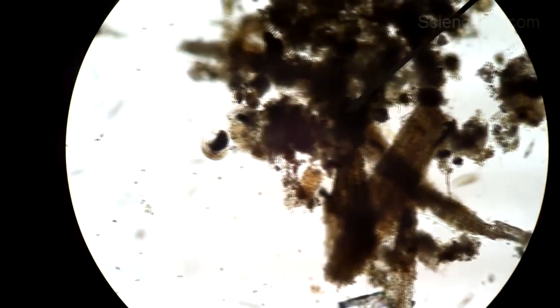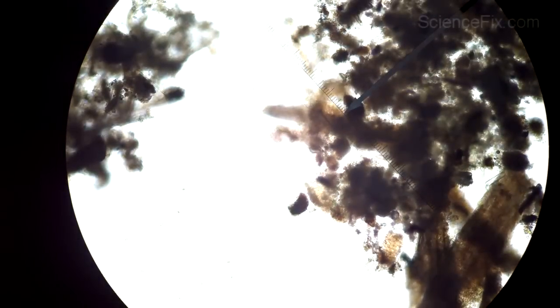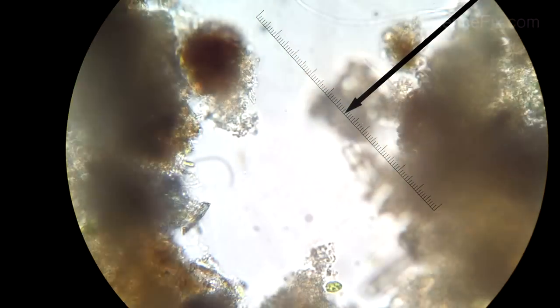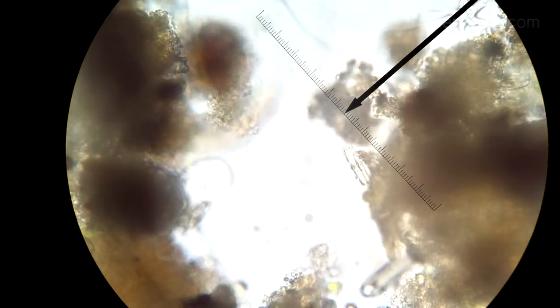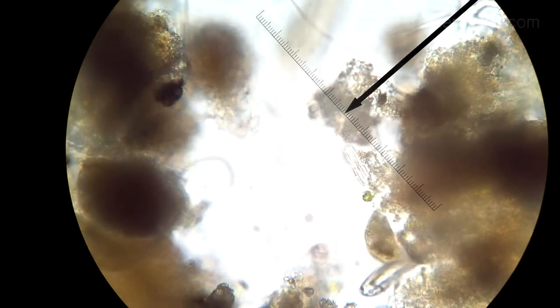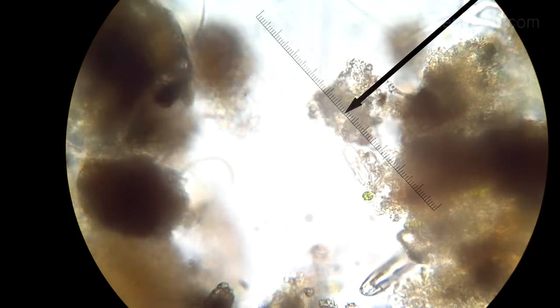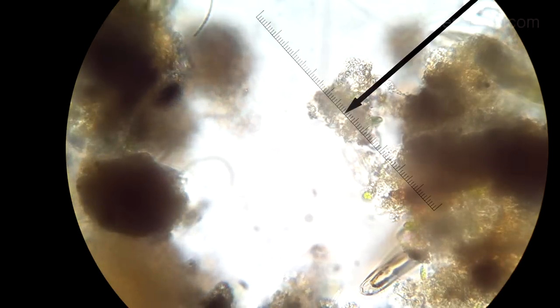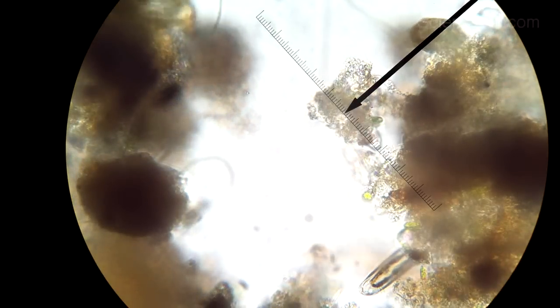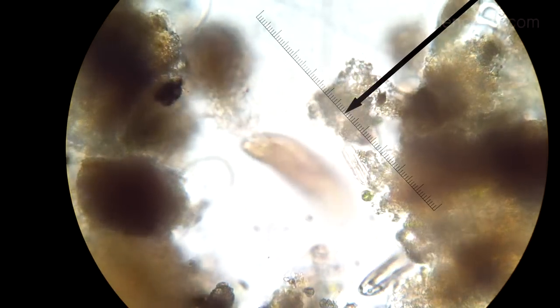Otherwise, if it's too bright you can't see all this detail. Just switching to a higher magnification here as well — sometimes the detail gets a little bit washed out. So you have to make adjustments with the diaphragm and also the focus adjustment, so you can see through the different layers and see a little bit more detail towards the top or the bottom of the slide.